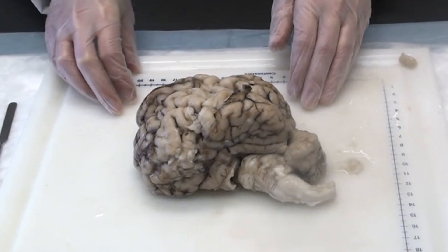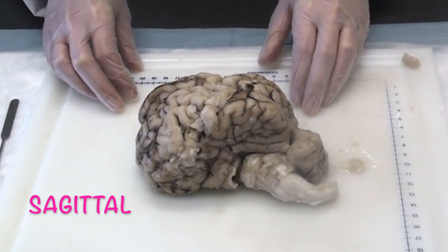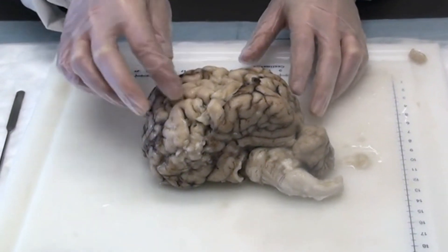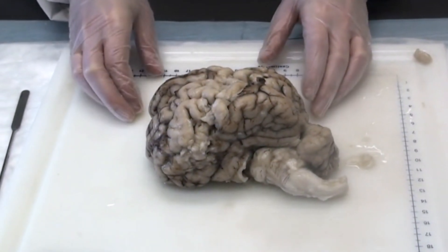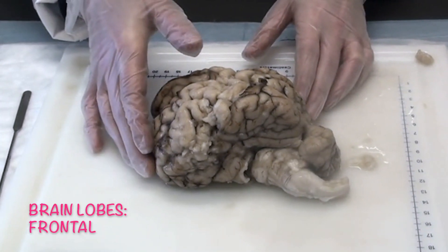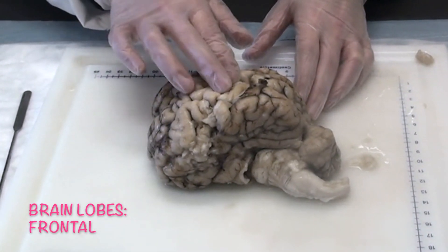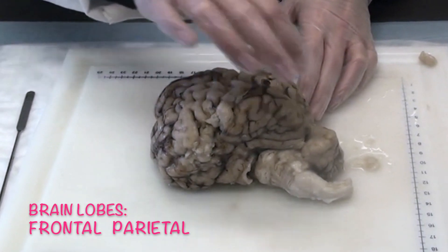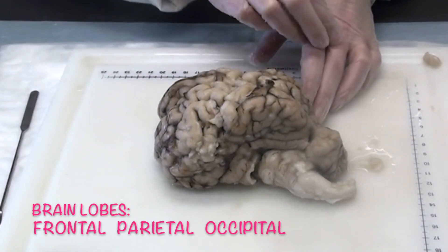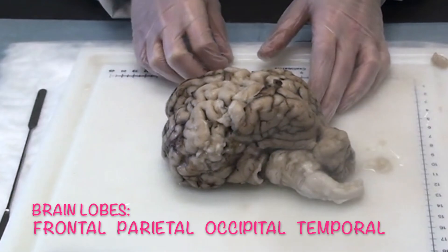Now we are looking at the brain from the side. This is called a sagittal view. Do you remember how we said that the bumps and grooves divide the brain up into lobes? The front part here is called the frontal lobe, the top part is called the parietal lobe, the back part here is the occipital lobe, and the part along the side here is the temporal lobe.